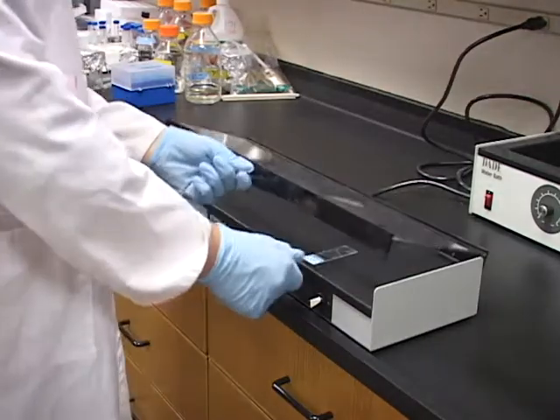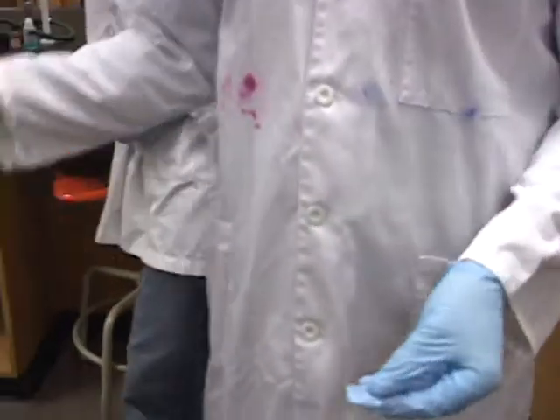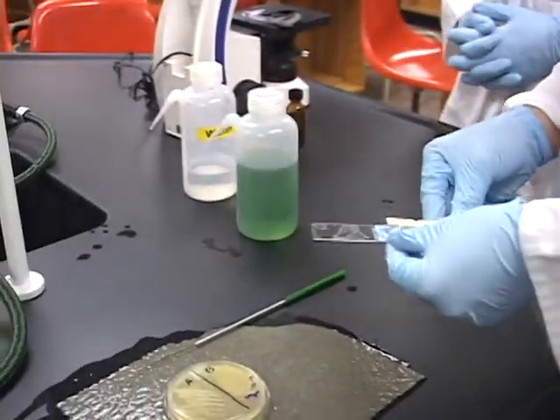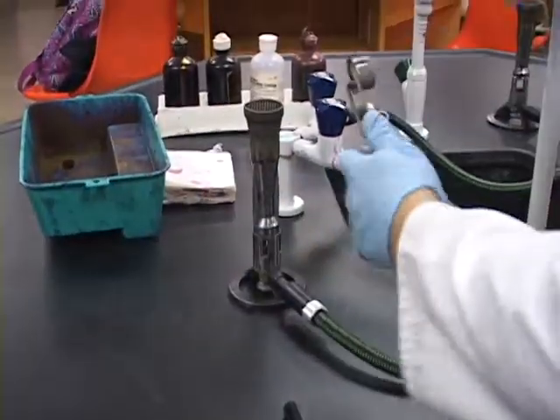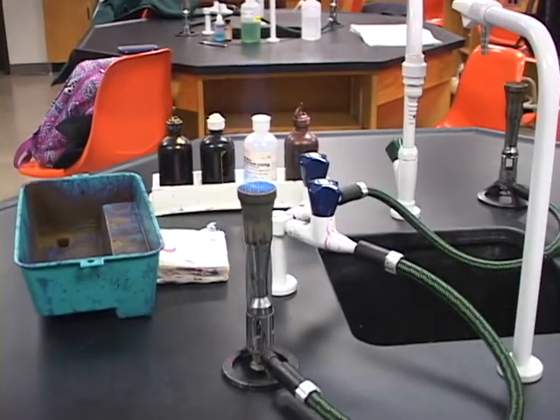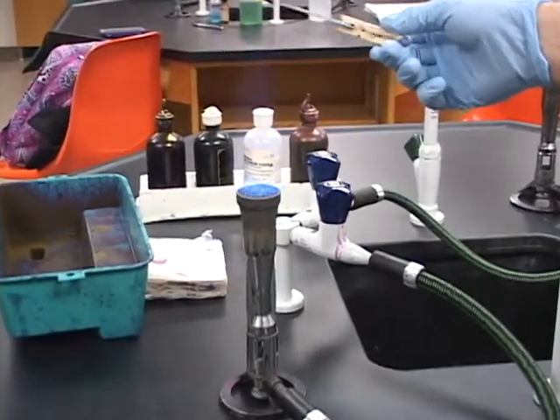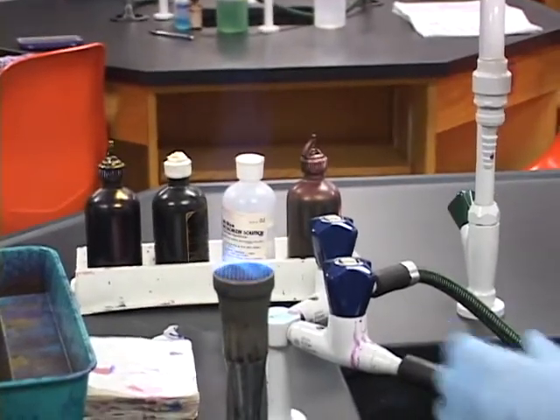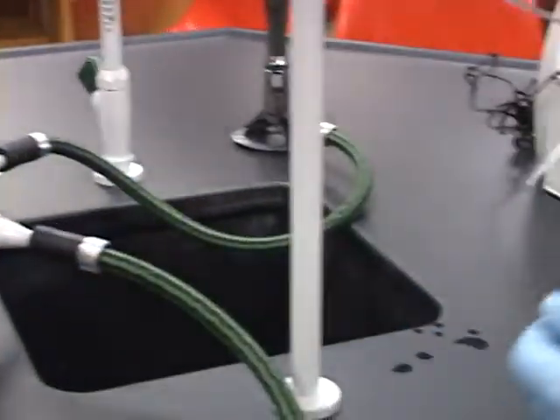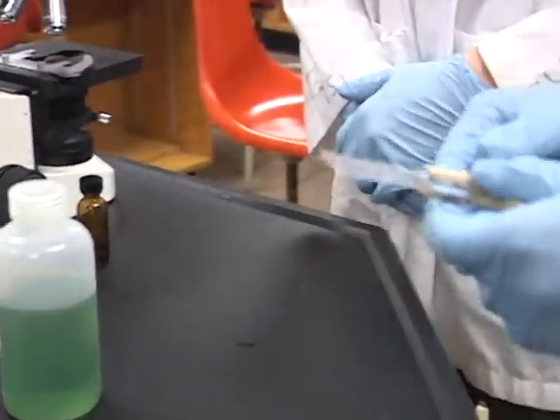After the slide has dried, we're now going to remove the slide from the slide warmer and transfer it using our clothespin. We're going to place it over the Bunsen burner to heat fix the microbes to the slide. You're going to do this by gently and slowly passing the slide over the open flame. Now, caution: the slide has been heat fixed, and you must be cautious because the slide can be brittle and hot. My assistant Joe will now show you how to properly stain the slide.